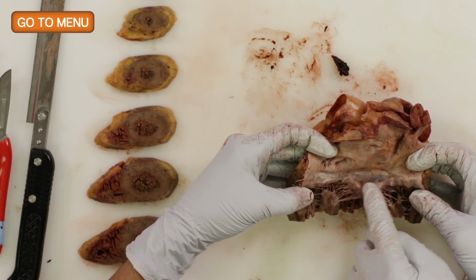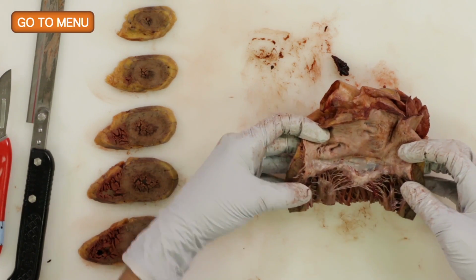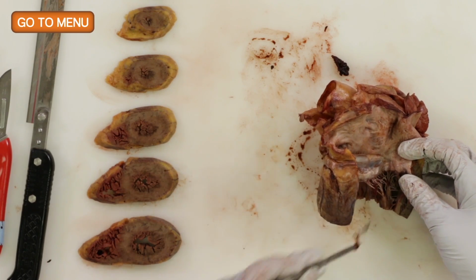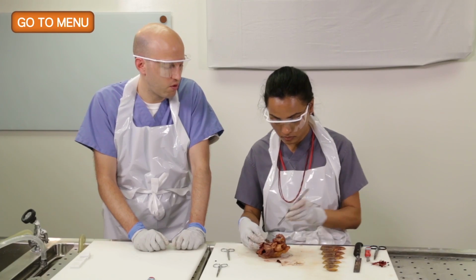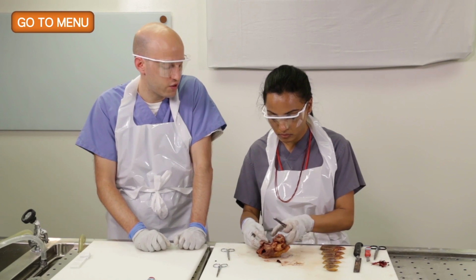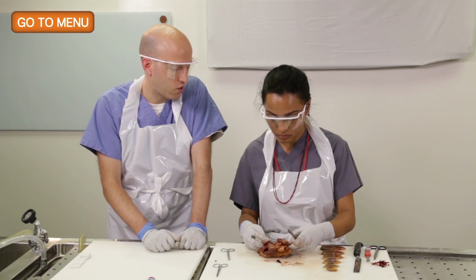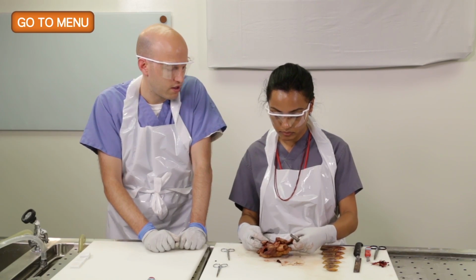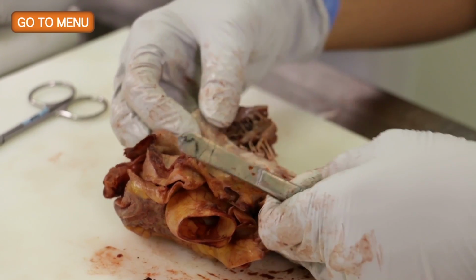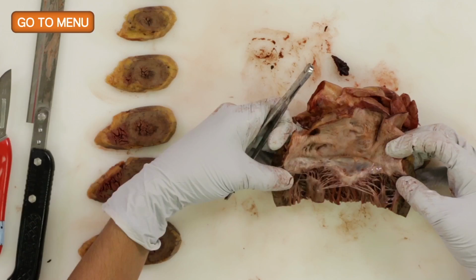So sometimes you can have complete stenosis. You don't see rheumatic heart disease so much anymore, but if you did, generally it involves the mitral valve. You can have a fish mouth deformity, thickening of the chordae, which this case does not. But it is a little calcified, I agree. So we'll make a note of that, but probably not leading to any significant stenosis.